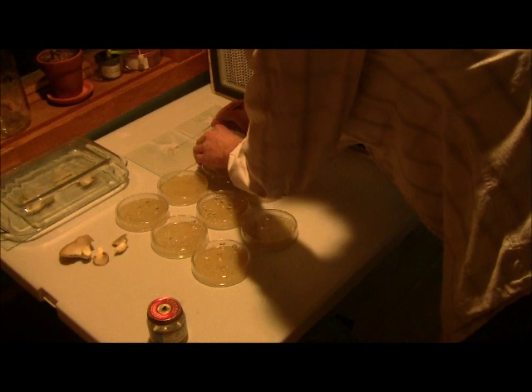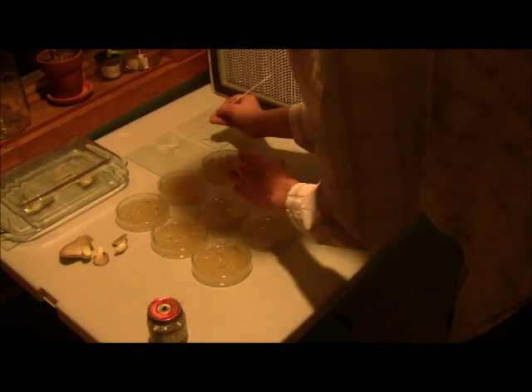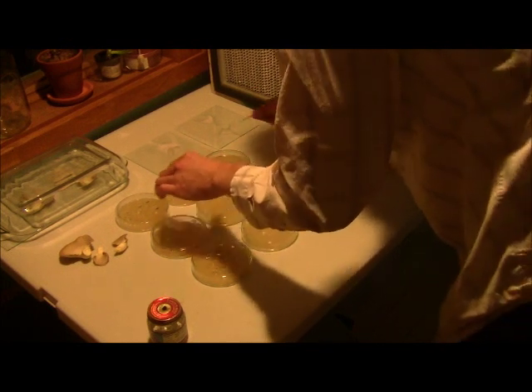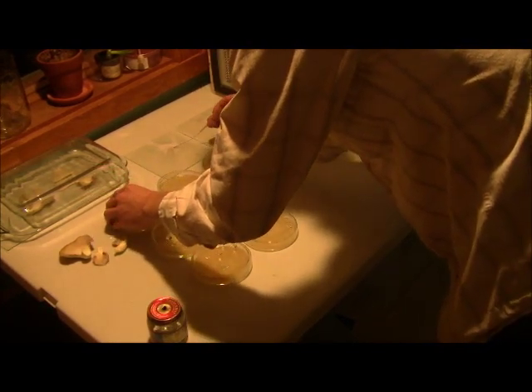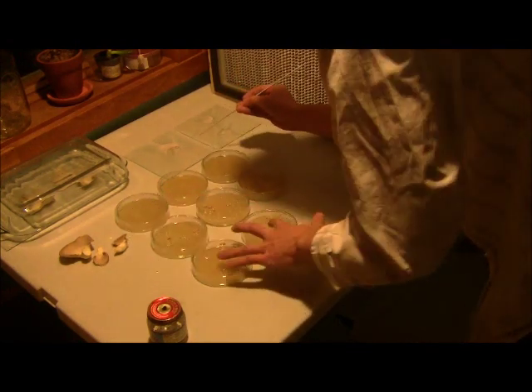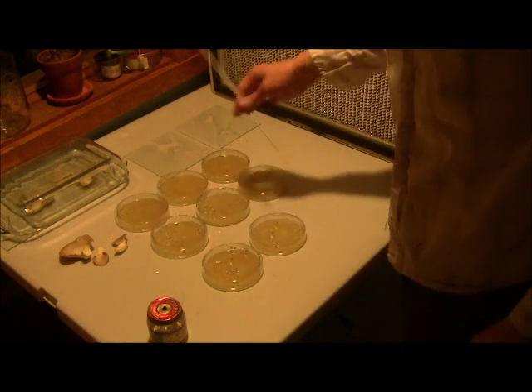It really isn't going to take much — just a little bit of that. You can make patterns, do whatever you want, be artistic, even draw a smiley face and see if it actually turns out. More spores in there can't hurt. I'll go around. So that's the spore print I used. I didn't follow my own advice and separate it out, but I'm going to grab one from the freezer because I want to save a couple.